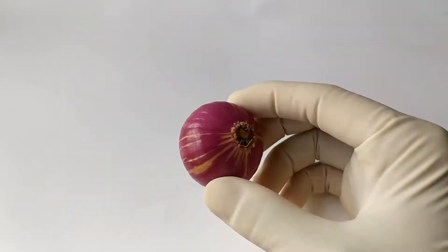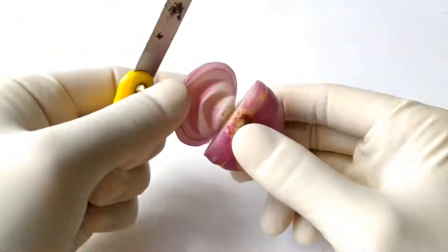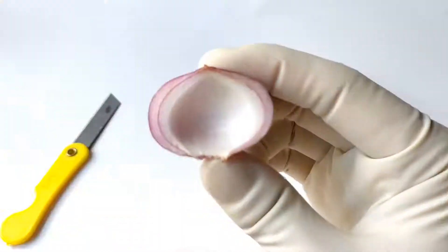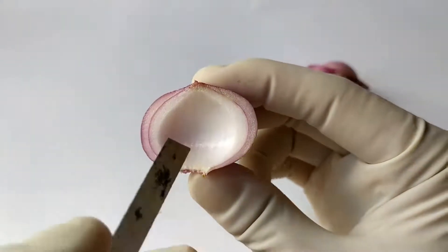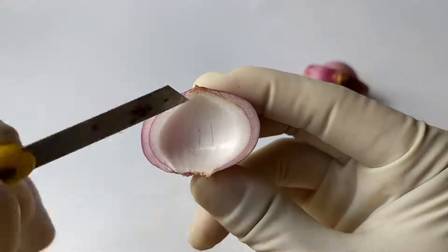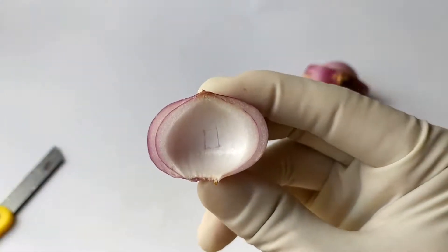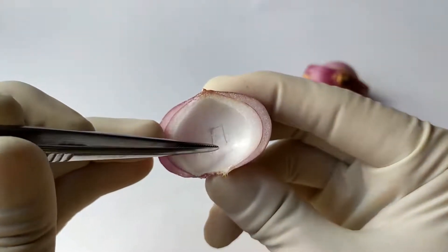To begin the experiment, take an onion bulb and remove an outer layer of the bulb. On the concave side of this layer is located a thin transparent membranous peel of epidermal cells composed of a single layer of cells. Using a blade, cut a tiny square on this layer. Now using a tweezer, peel off the cut epidermal layer.